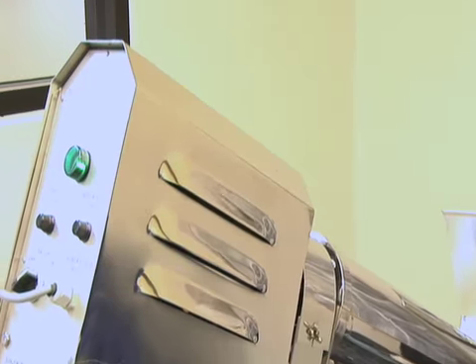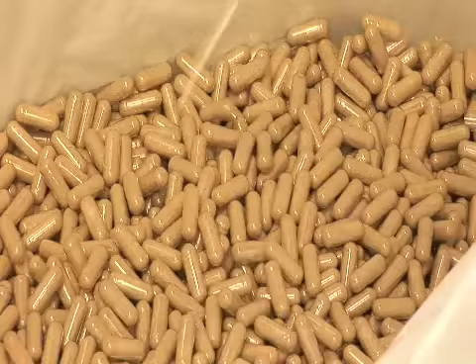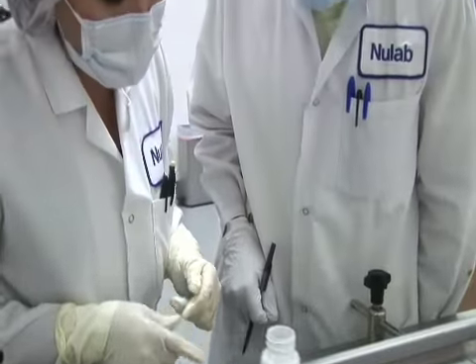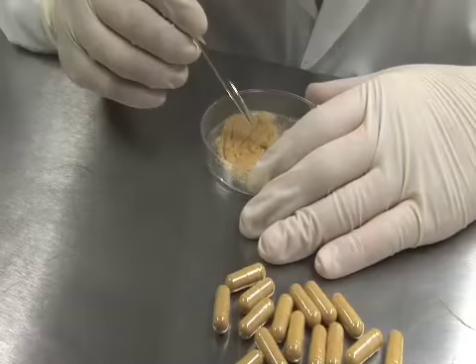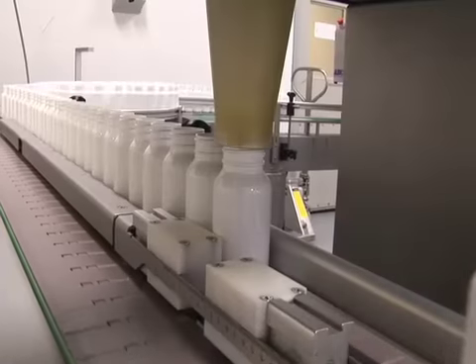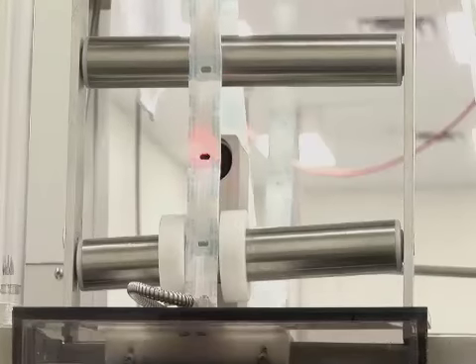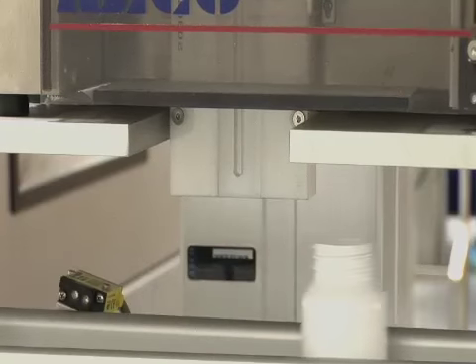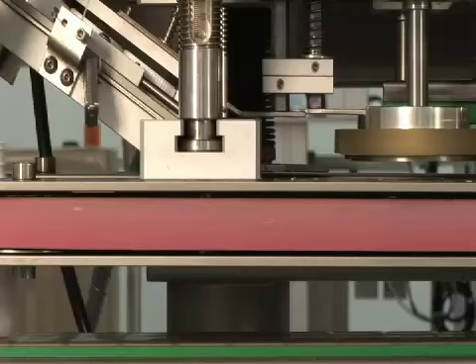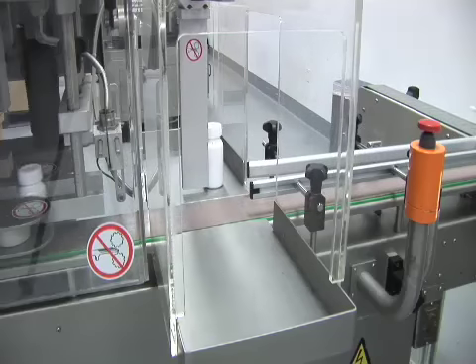The capsules are now polished and go through an inspection process that removes any that are dented or cracked. The quality control director will reject a product that fails an inspection at any time during the production process. Bottling of capsules is a high-speed automatic process that includes several points of quality assurance. Sensitive products get a moisture-absorbing pouch inserted into the bottle. The capping station automatically rejects improperly capped bottles.